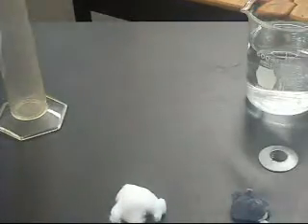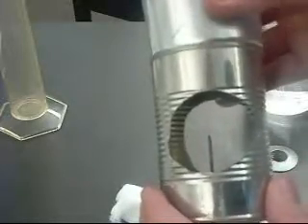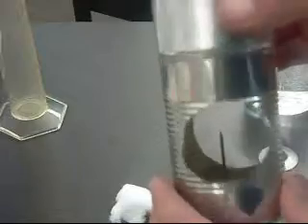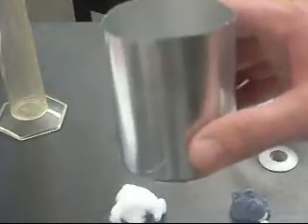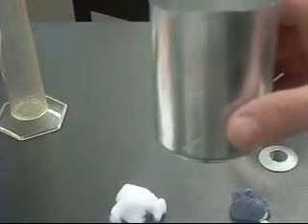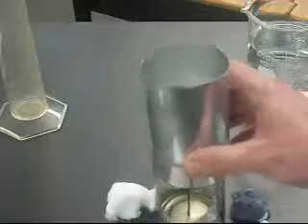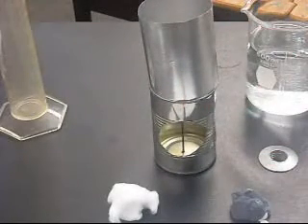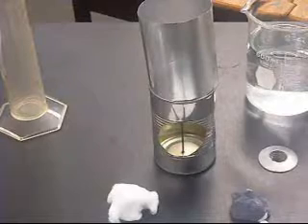What you'll be doing is burning our lint sample, placing it on this little needle right there, it's actually a nail, and burning it, and in our tin can here we will have our 100 milliliters of water. So these two will go together to form our calorimeter like that. Okay? So those are the tools that you're going to be using.